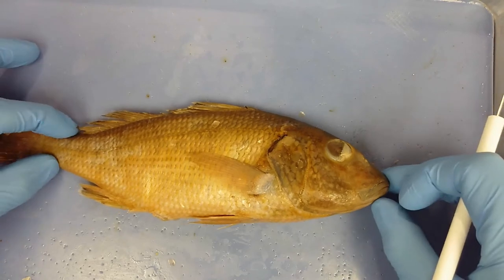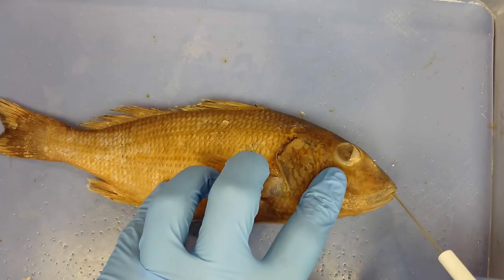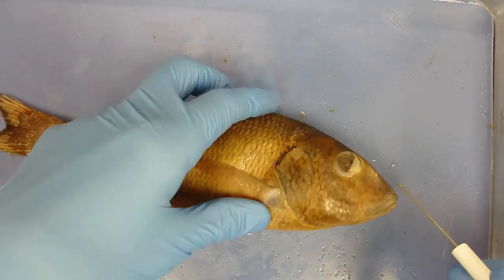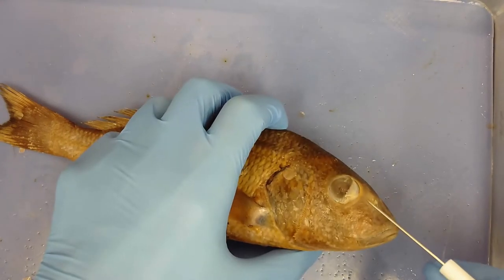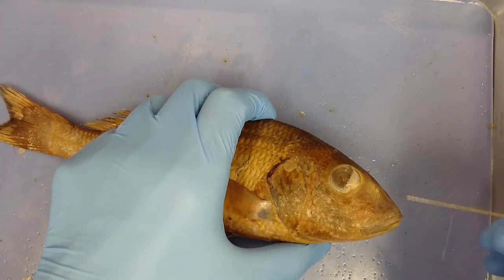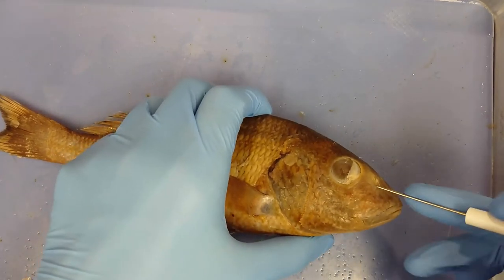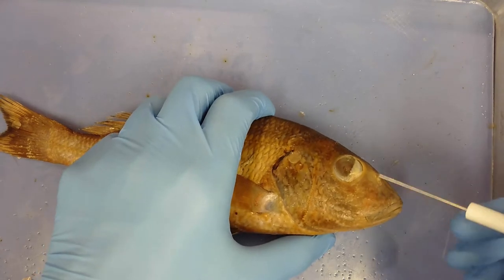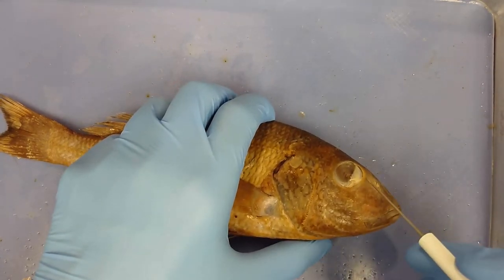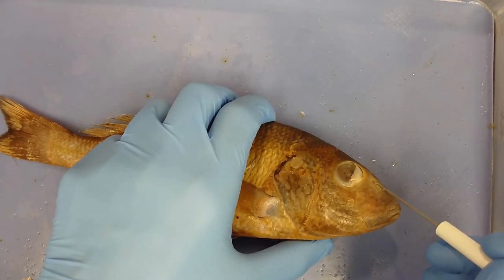Other external anatomy includes the eye, the mouth, and the incurrent and excurrent nares at the tip of the head. These are chemo-sensory — water flows into the incurrent nares carrying pheromones and hormones, which are read by cells within the canals, and then flows out the excurrent nares.